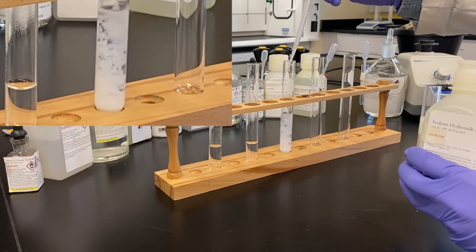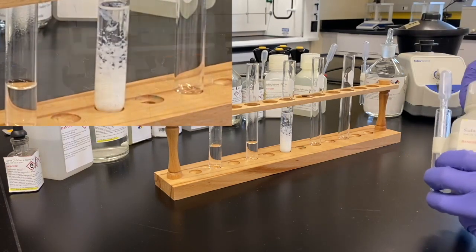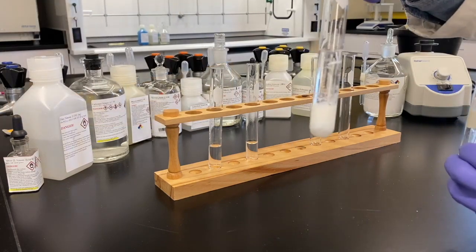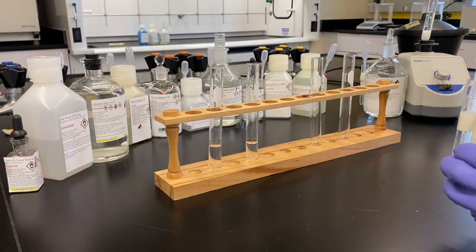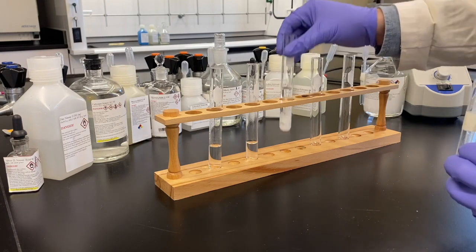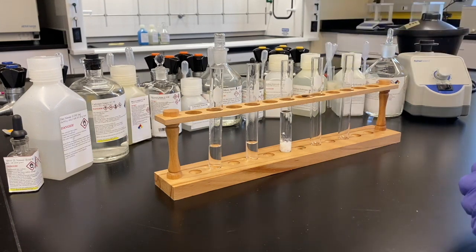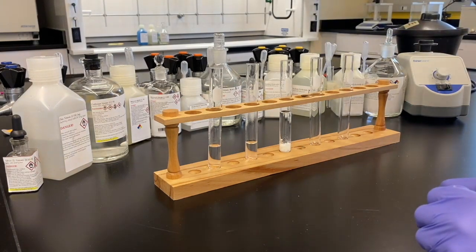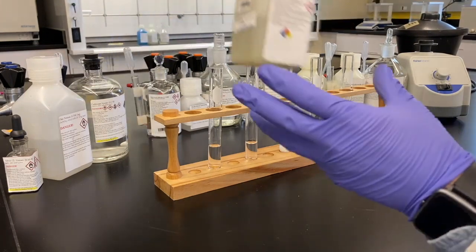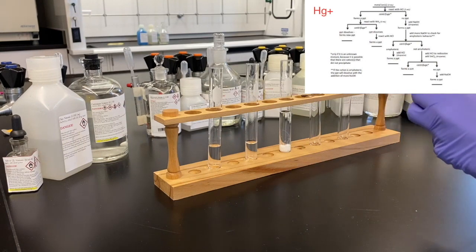Looks like cadmium hydroxide. Apparently. It's cool. It's like a snow globe. So we'll notice that our tin chloride solution there didn't change anything. We had just neutralized the acid and then we added more base to get back our cadmium hydroxide and finished with that. Now we're on to mercury 1.